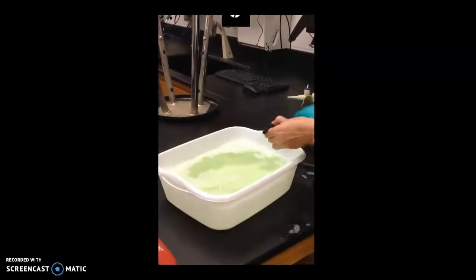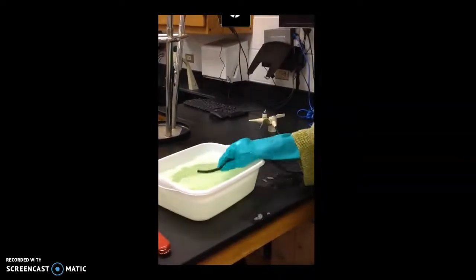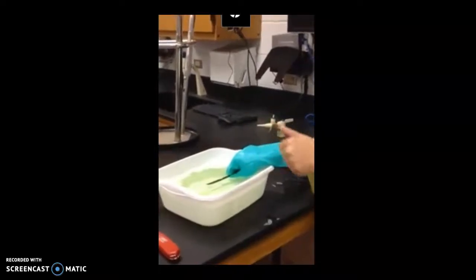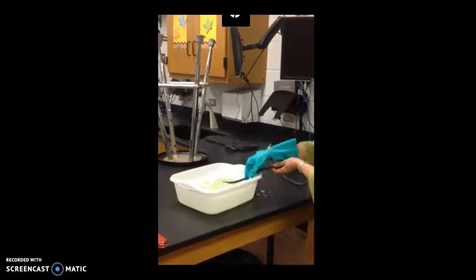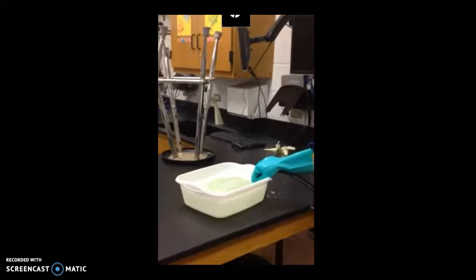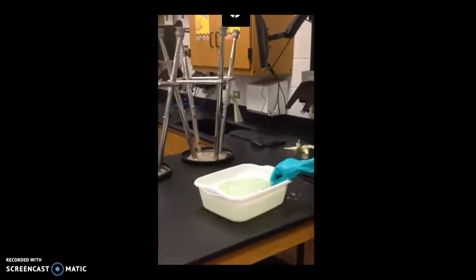So I have a bath and I'm going to add some gas outlets. The moment that I submerge this, it's going to form bubbles, methane gas, and then we're going to see what happens. Okay, so now we're going to go ahead and submerge and start creating the bubbles. This is going to happen fast, so let's go ahead and watch what's going to happen. Okay, here we go.